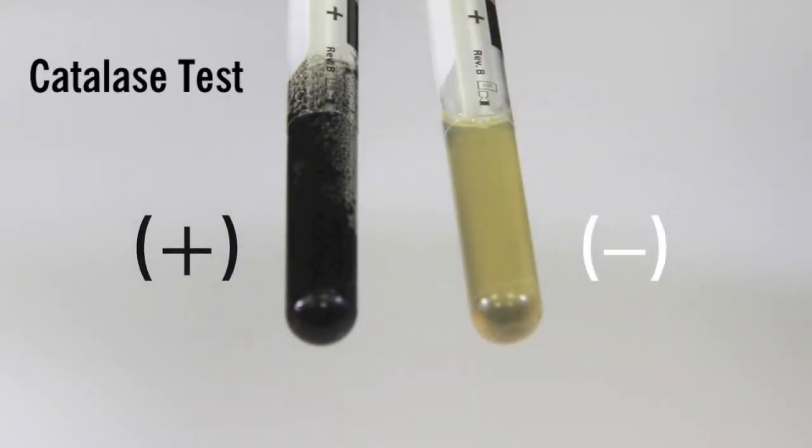For confirmation of positive results, you may perform a catalase test using hydrogen peroxide.